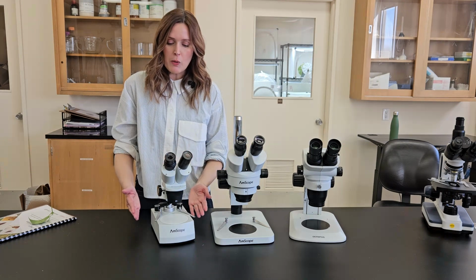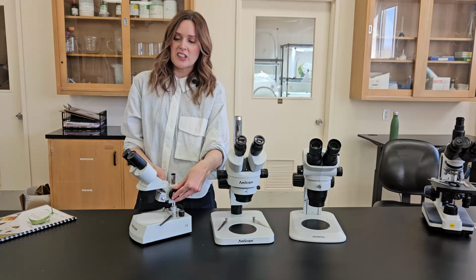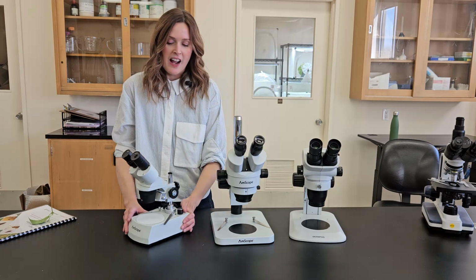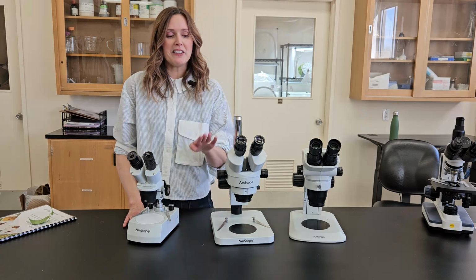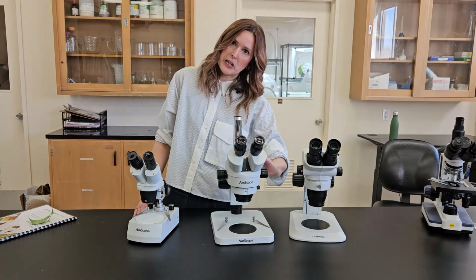I've also had growers mention during our workshops that because everything's smaller, like the little knobs, this can be difficult to work with if you have large meat hands, as one of the growers put it to me. So it all comes down to preference and how easily annoyed you are by things. That's why I would probably recommend this one in terms of both cost and being less annoying.